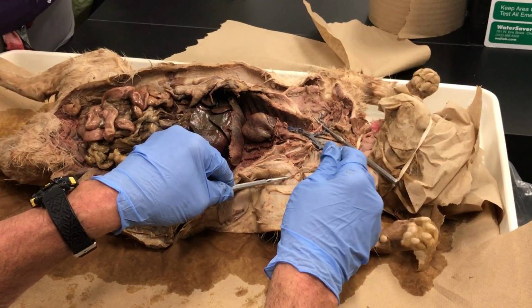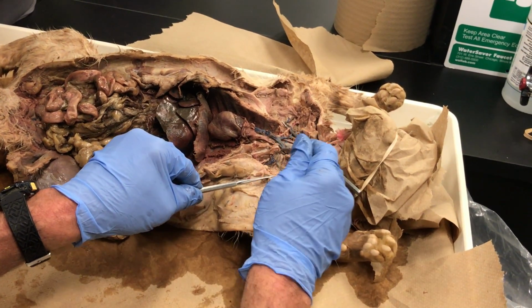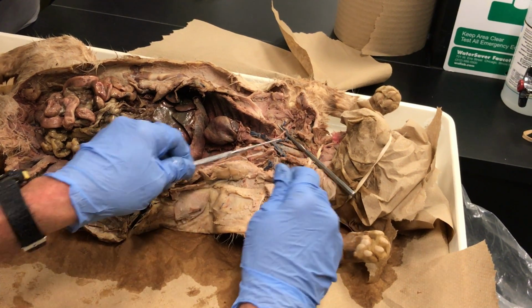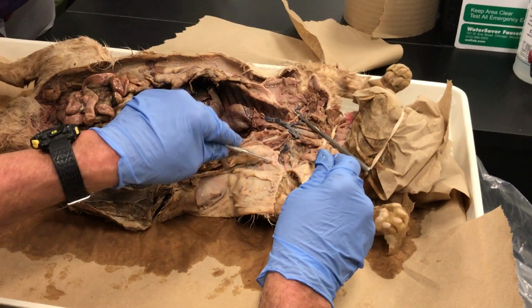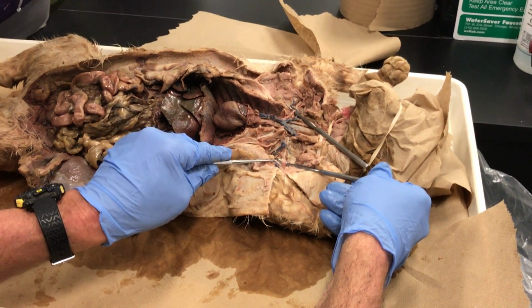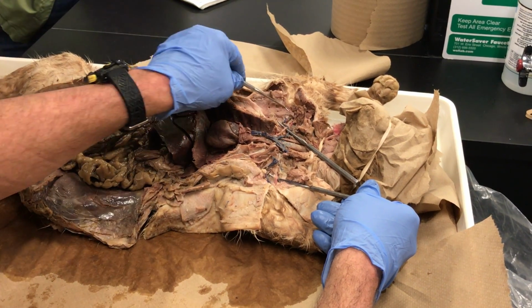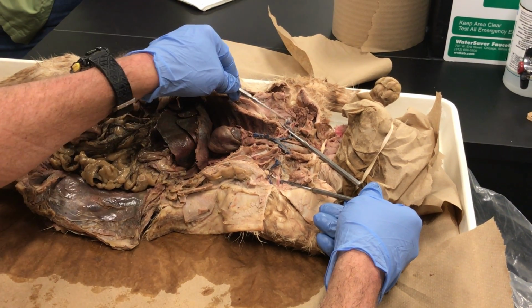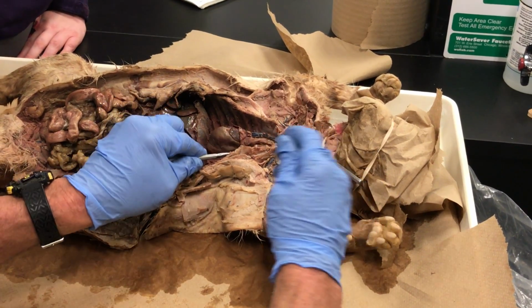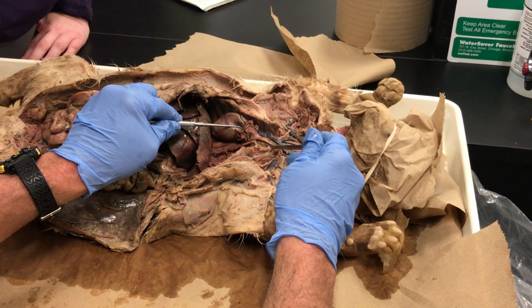Now, this is where the red vessel kind of got busted out here as well before it came to me. I didn't have access to this, but there would have been the same names. There'd be an axillary in the armpit, and I didn't dissect this out too far, but you guys see that pink tube down there? That would be a brachial artery down there. So way out in the arm is brachial. So the names are the same. The farthest out in the arm you can get is brachial, come in towards the armpit, and you would have axillary. And then if I want subclavian, I'll be way down here in this one tube all by itself.